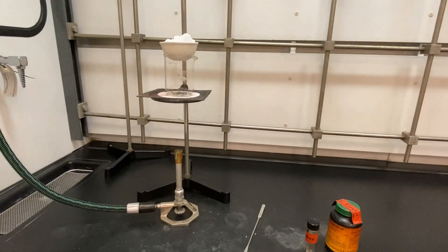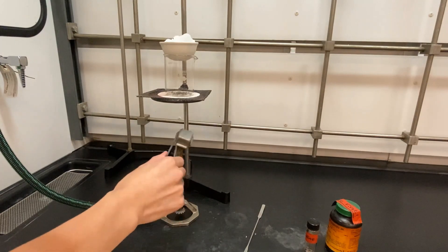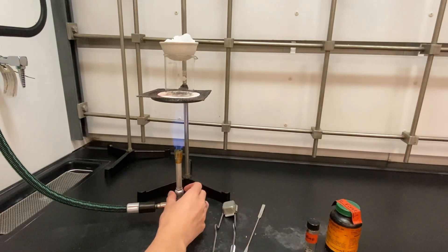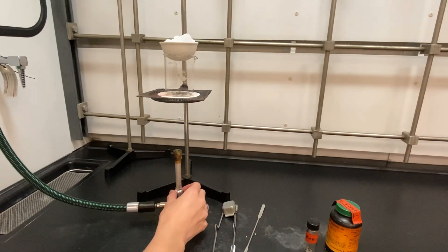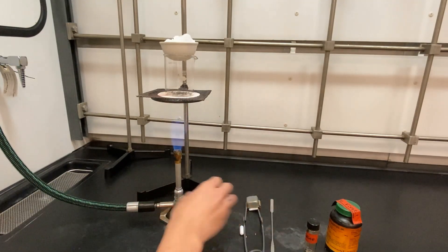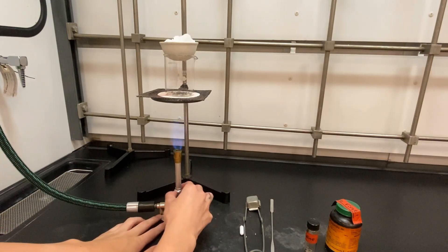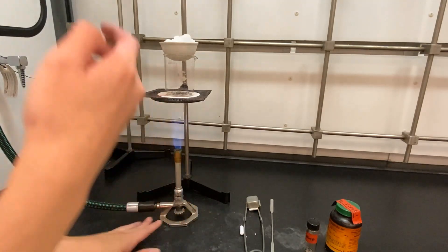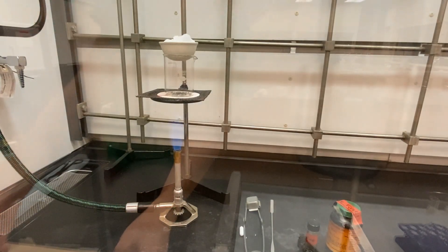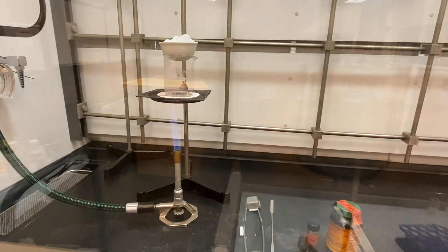This is an evaporating dish filled with ice. The ice will make the bottom of the evaporating dish cold for the entire experiment. A striker is used to light the Bunsen burner, and as the natural gas burns, it releases heat that is used to warm up the sample of iodine. This experiment is done inside of a fume hood to protect the experimenter from any fumes that are produced during the heating of the iodine.